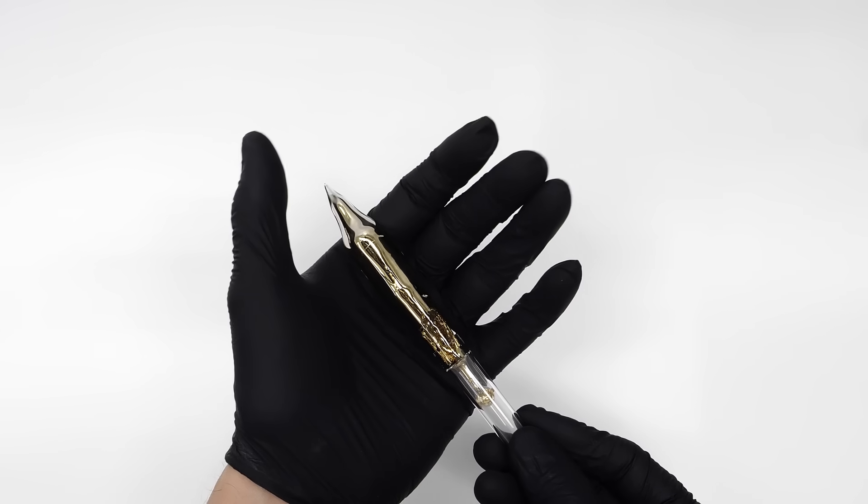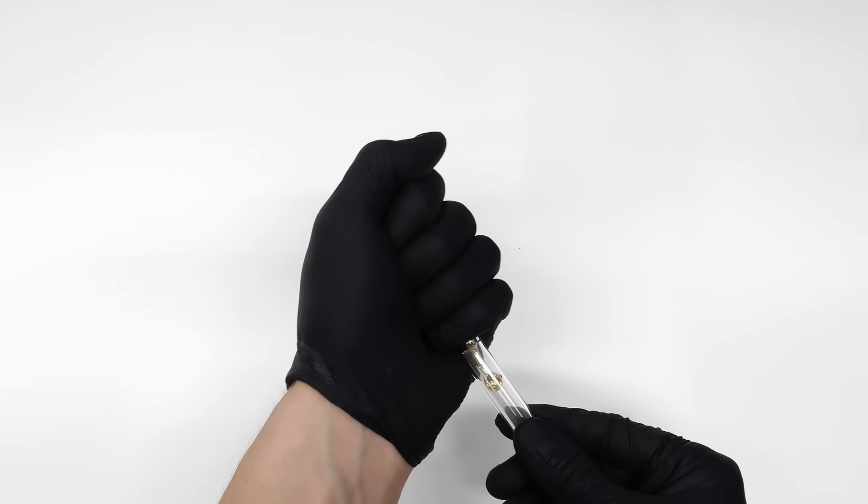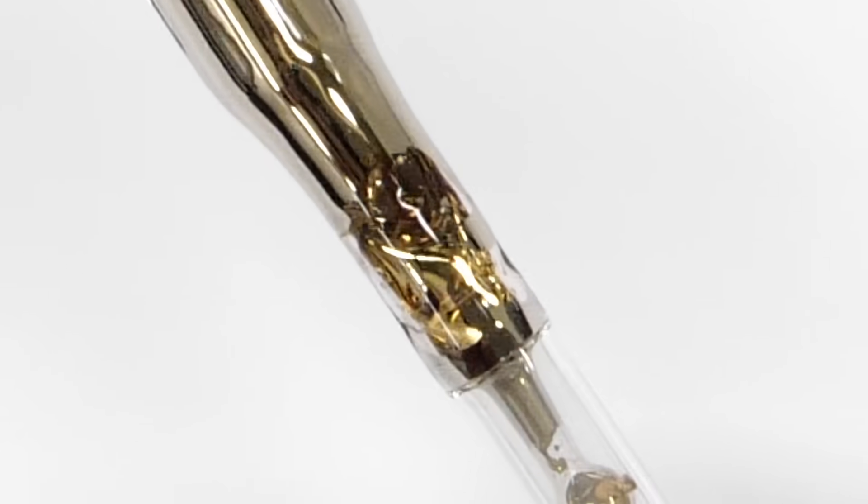What's interesting though is what happens if I hold it for about 20 seconds. Just the heat from my hand was enough to melt it, and I now have some slightly golden, liquid metal.